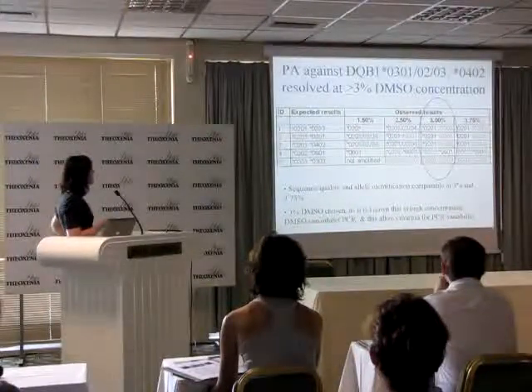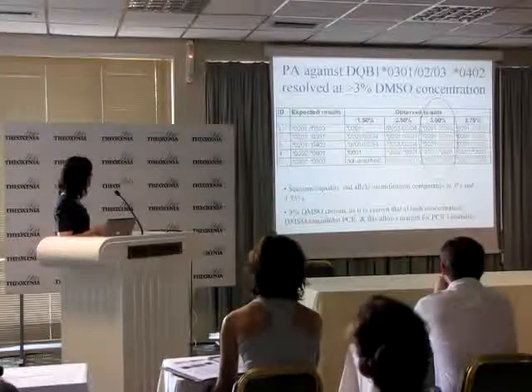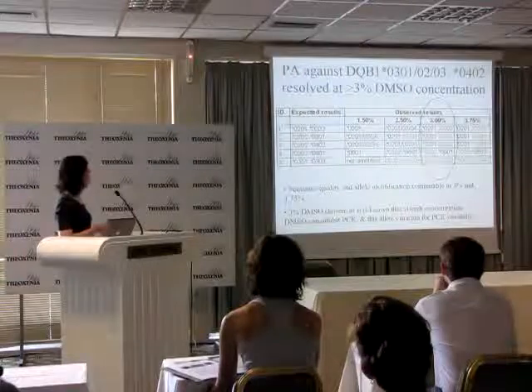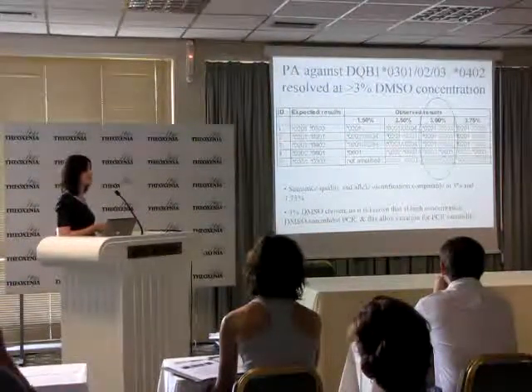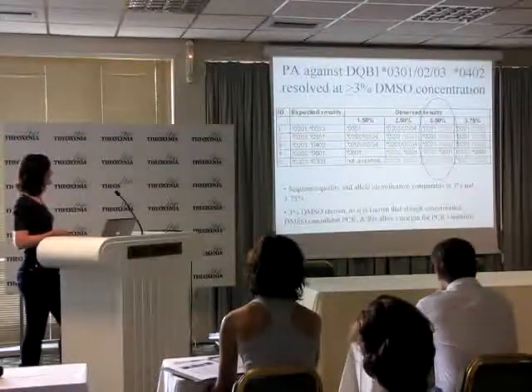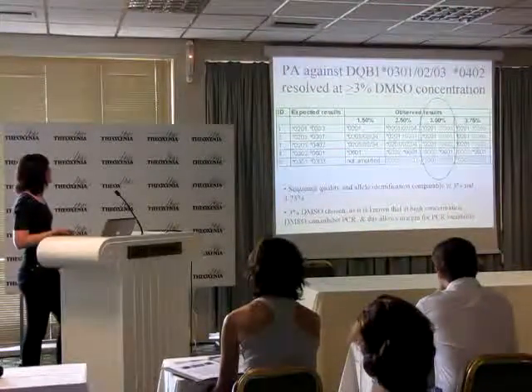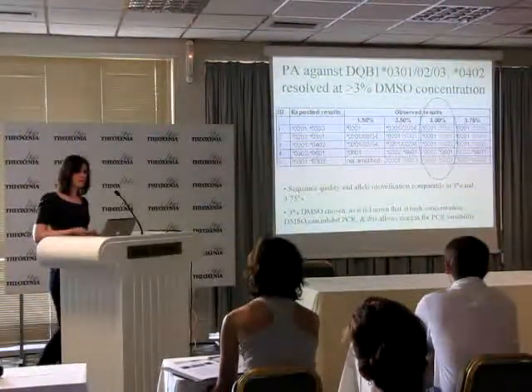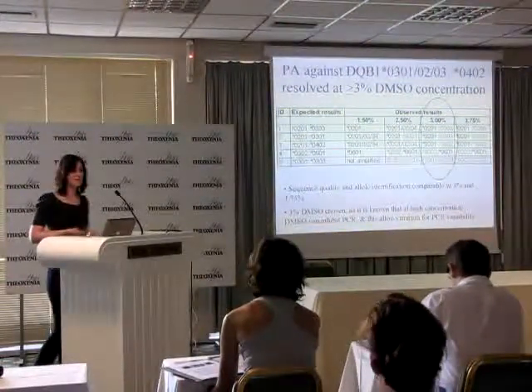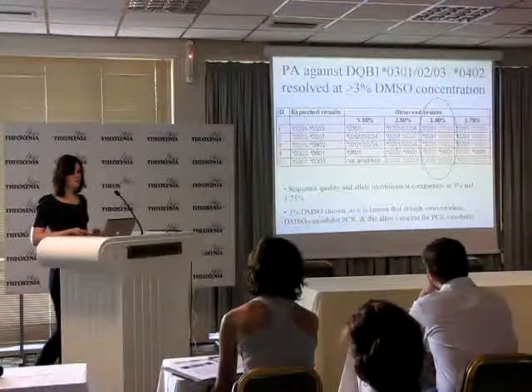And as you can see from the table, you can see the second alleles coming through for these samples, but it wasn't until the 3% DMSO that you were getting both alleles for all those samples that had PA. So the sequence quality and allele identification was comparable at 3% and 3.75%. 3% was chosen because, as it's known, DMSO at high concentration can inhibit the PCR, so using 3% will allow for PCR variability.